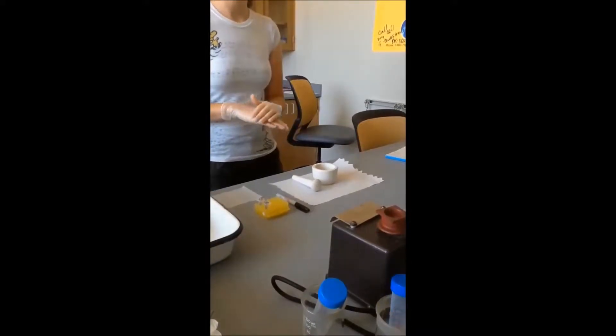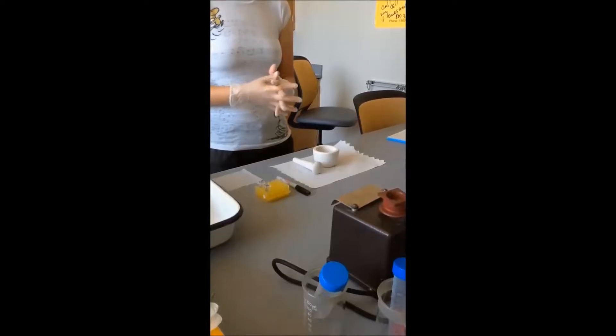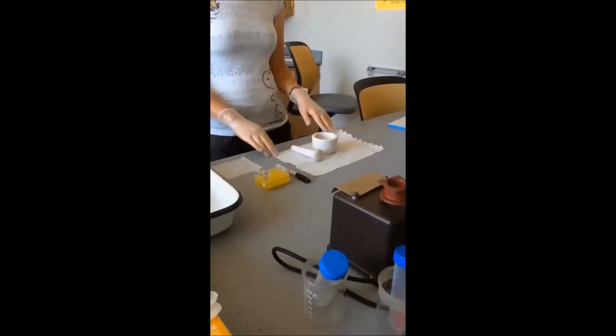Today we are going to be grinding samples and we will be wearing our gloves and goggles for personal protection and to prevent contamination between the samples.